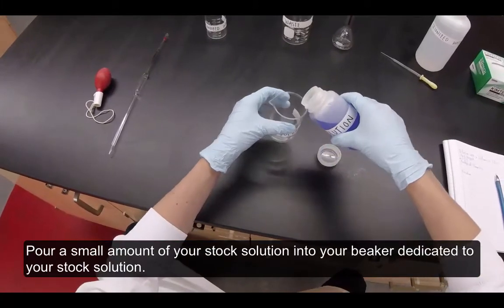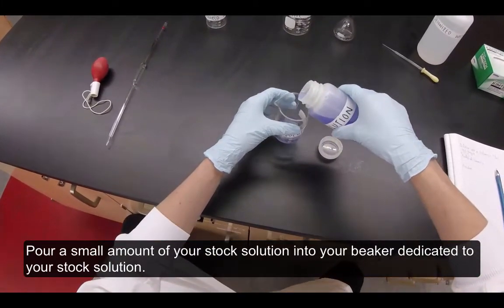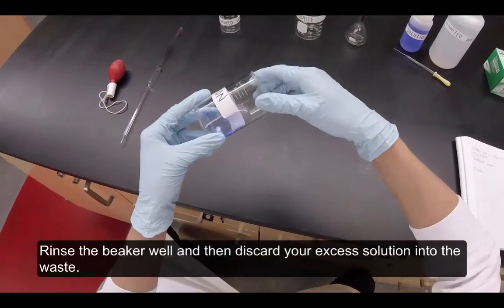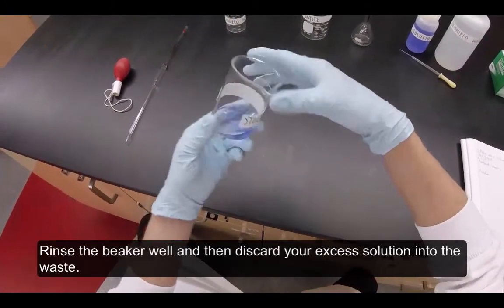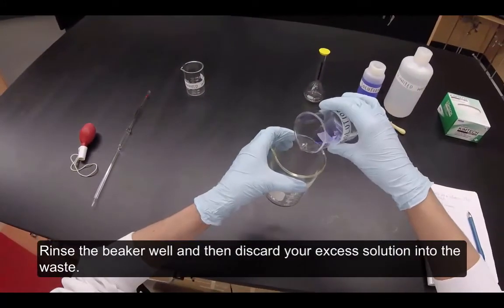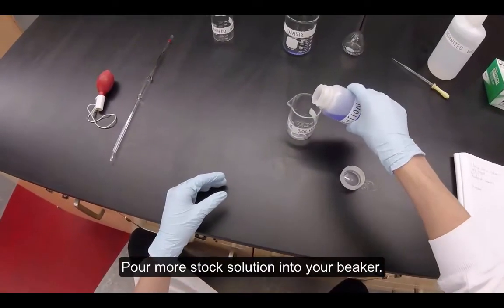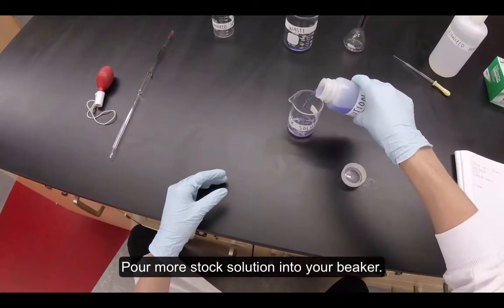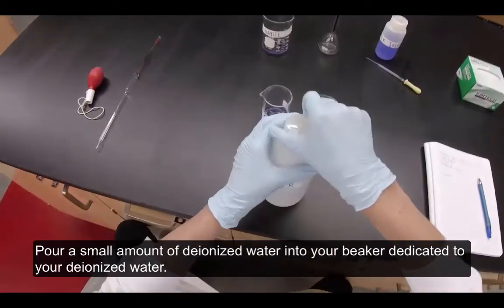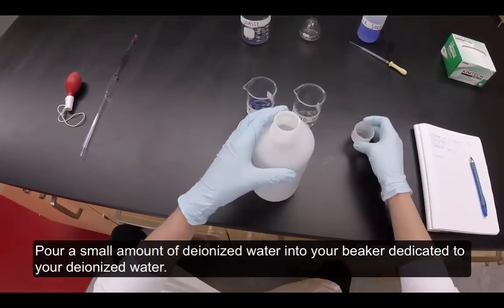Pour a small amount of your stock solution into your beaker dedicated to your stock solution. Rinse the beaker well and then discard your excess solution into the waste. Pour more stock solution into your beaker. Pour a small amount of deionized water into your beaker dedicated to deionized water.